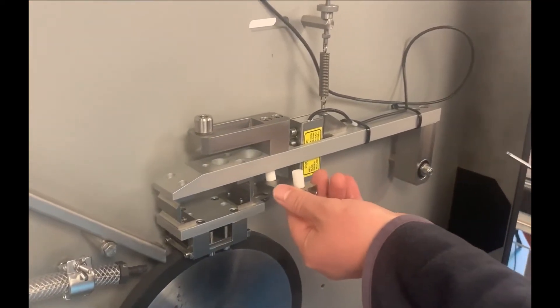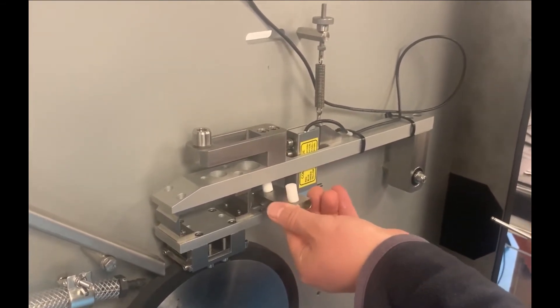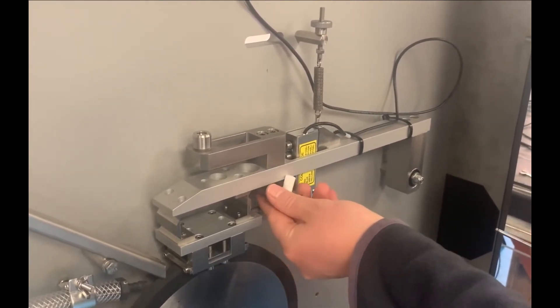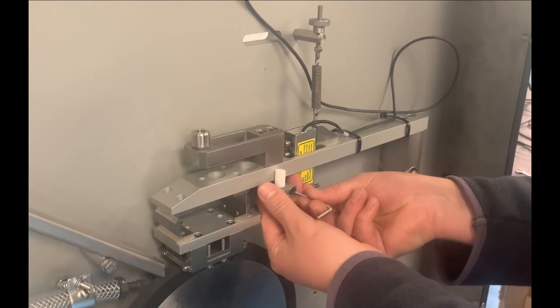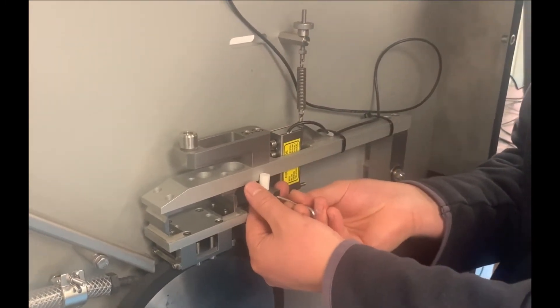Now fit the load arm guide block. Note that the PTFE pillars are mounted through slotted holes, allowing the clearance to be adjusted.